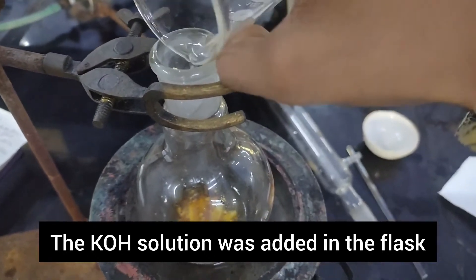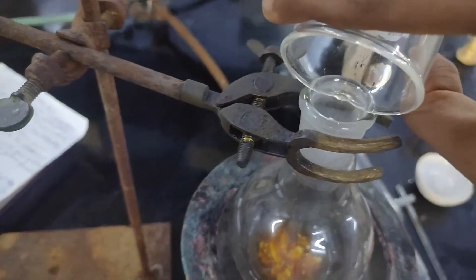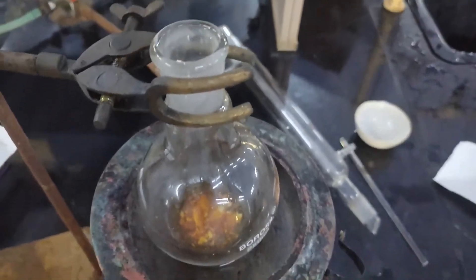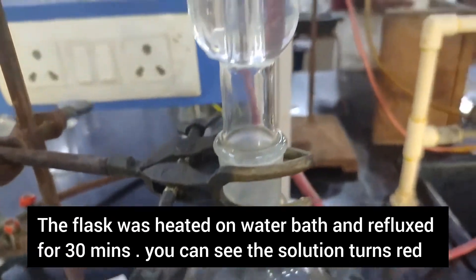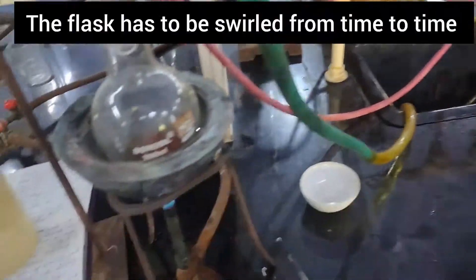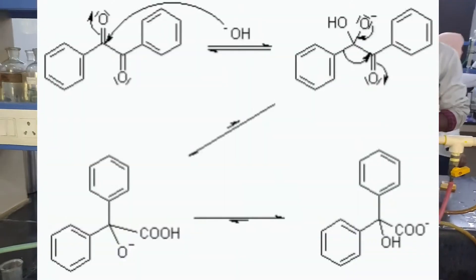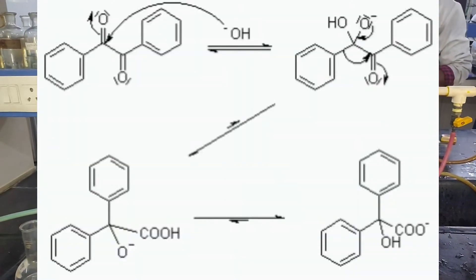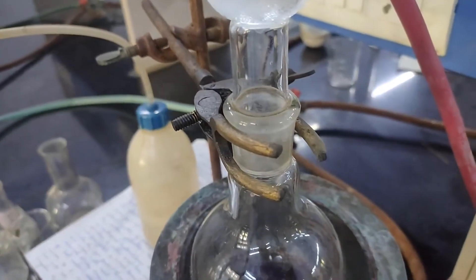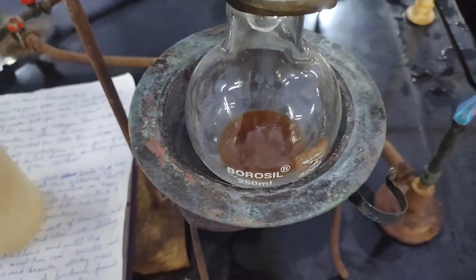The flask was heated for 30 minutes on a water bath with a reflux condenser. You can observe that the solution in the flask has turned red. It is also important to swirl the flask from time to time. The reaction occurring here is the benzilic acid rearrangement — benzil is getting converted into the potassium salt of benzilic acid.